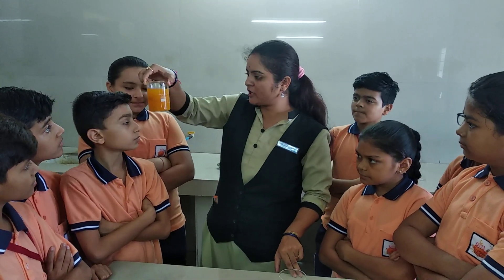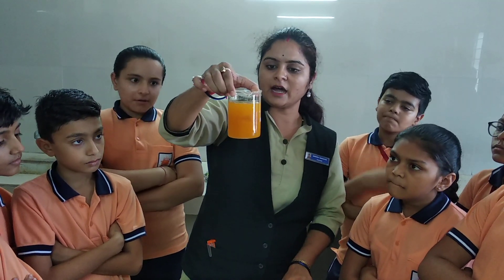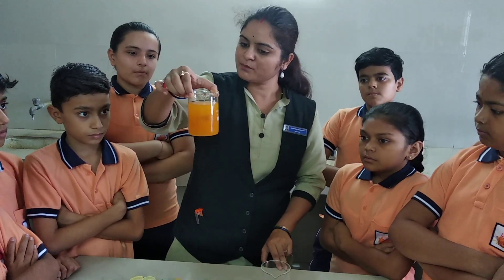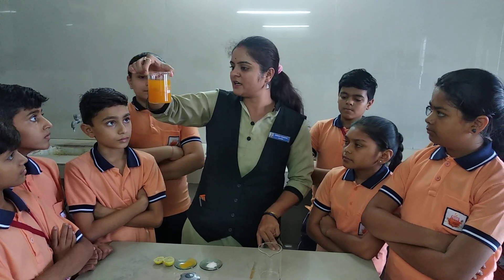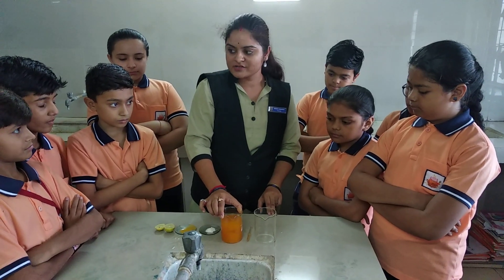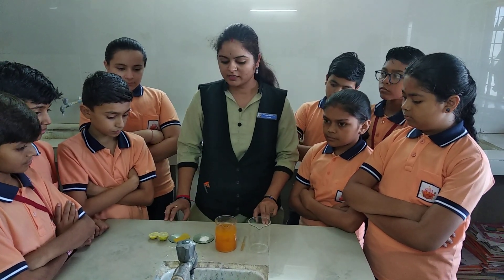Yes, the turmeric particles are moving in the water. So we have to get the particles settled down. We have to keep this beaker undisturbed for 5 to 6 minutes so that all the particles of turmeric powder get settled down at the bottom of the beaker. After that we have to see the changes in the water.